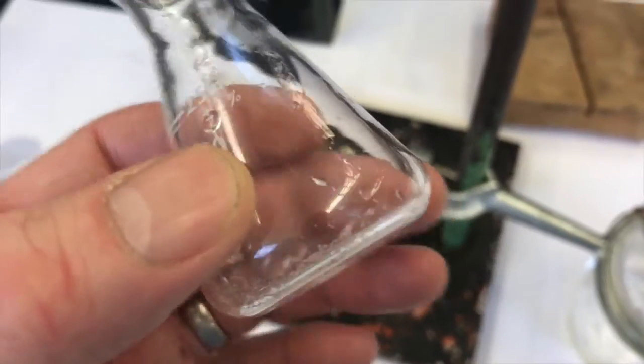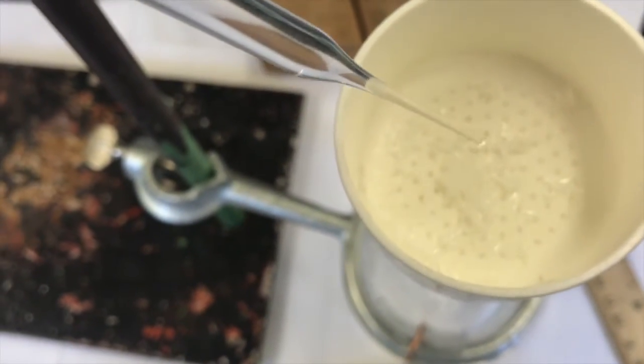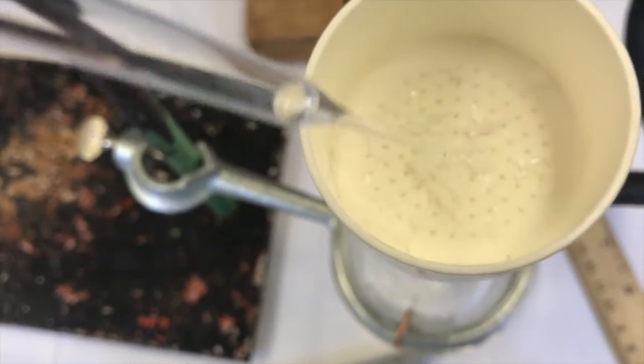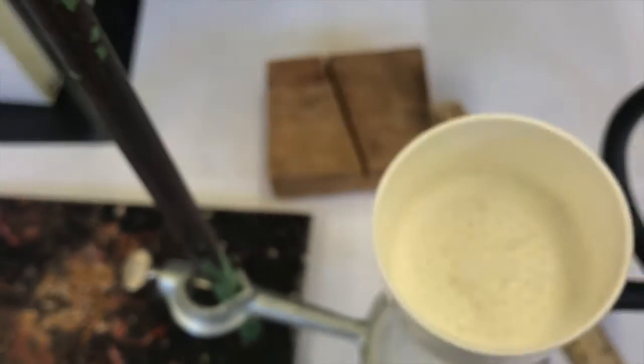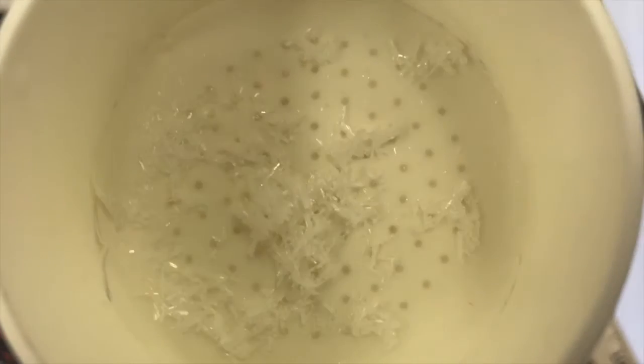I'll do one more of those. Seems to be going okay. Swirl, swirl, swirl. Dump. I've still got some crystals stuck to the bottom of this flask. I'm going to count them as lost. I'm going to say that's okay. And if I want, I can try to rinse these crystals a little more with fresh methanol. But I don't want to do too much, because every time I do rinse them, I'm dissolving them as well. If I just kept saying, oh, I want to clean up all the mother liquor, and I just kept putting more and more cold methanol, eventually all my crystals would dissolve. But that looks pretty good.